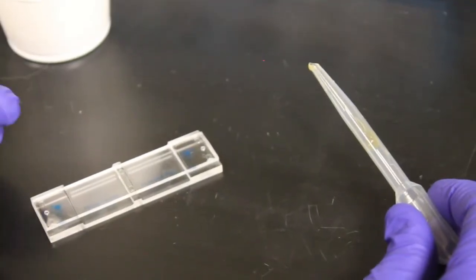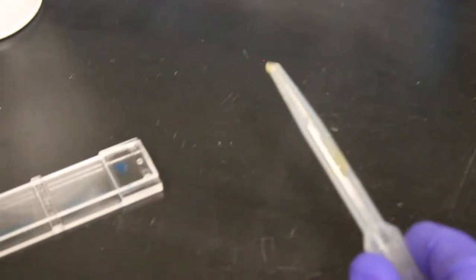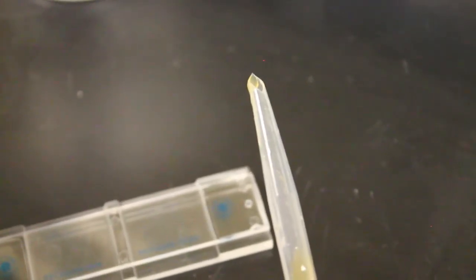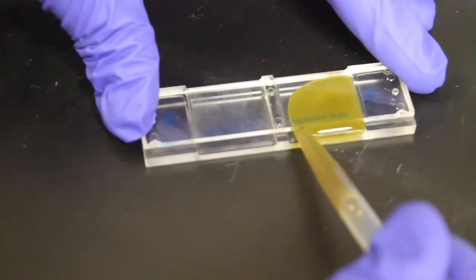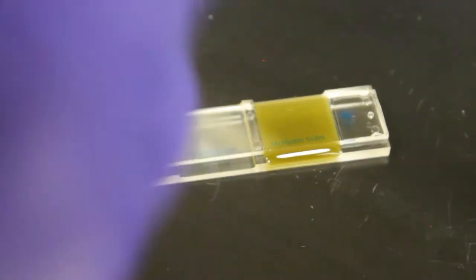The next step is to take a pipette and place our solution into a McMaster slide. Here is a pipette that I have taken and cut off the tip and modified to make it a little bit easier to pipette in the solution. Do this at a little bit of an angle so that you don't spill any of your feces. We want it nice, even with no air bubbles, like so.